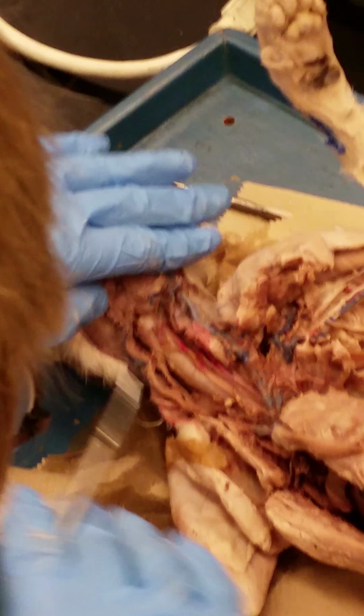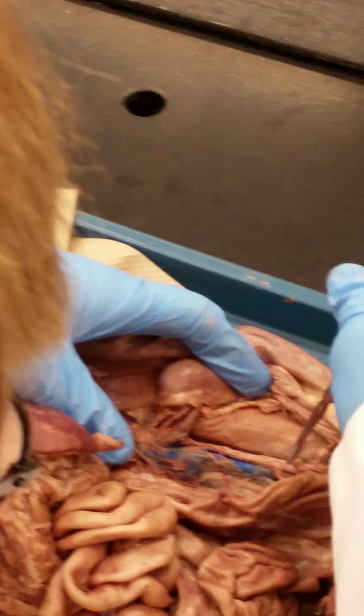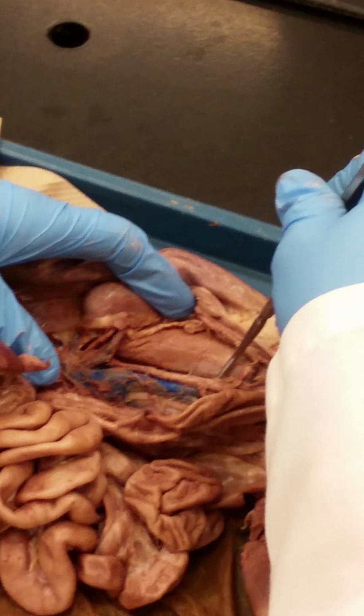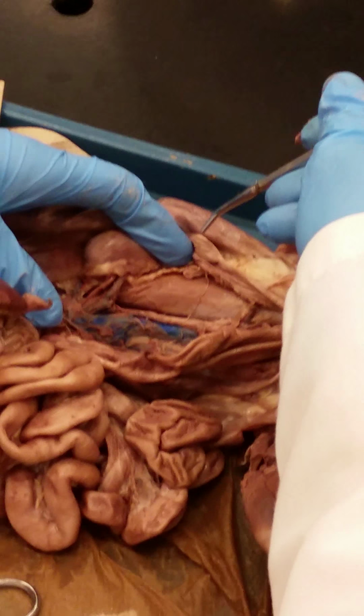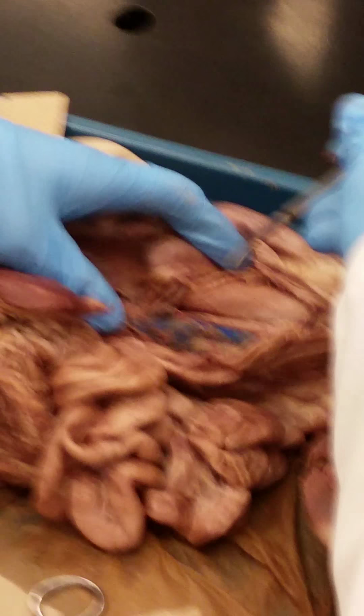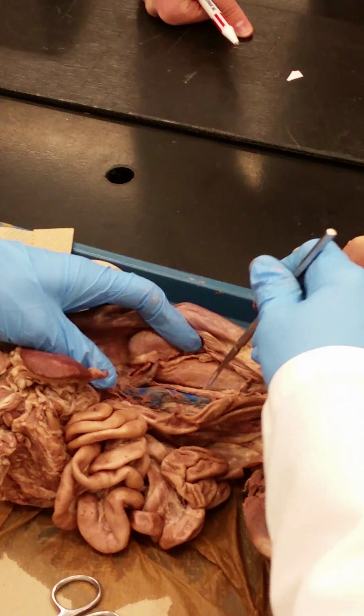And it's not great on this kitty, but it's certainly good on others, so it would be fair game for the practical. Questions on the veins? Your aorta. You know, it's just like what we do with the bones. Sometimes people remembered all those little structures on the bones and they couldn't remember what the big bone was. So make sure you know the large arteries and veins and not just the little branches.